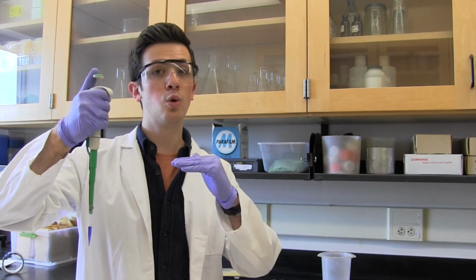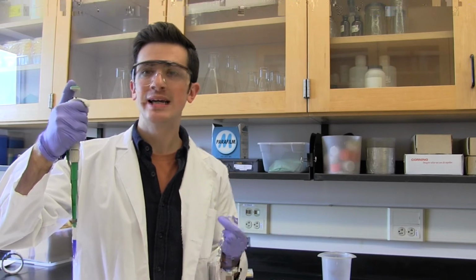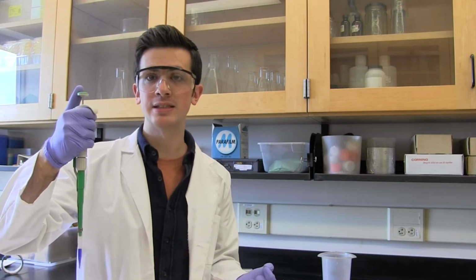Now that we have the liquid in our pipette, though, you're going to want to be very careful. You might think you can relax now that you've inserted it vertically and picked it up, but you can't. Keep holding it vertically. Moving it horizontally or laterally or laying the pipette down at this stage could allow liquid to be pulled back into the pipette mechanism. This would not only damage the pipette mechanism, but would contaminate it, rendering all future experimental results inaccurate, potentially without future experimenters even knowing. These pipettes are used throughout our department, so it's very important that you take care of them.